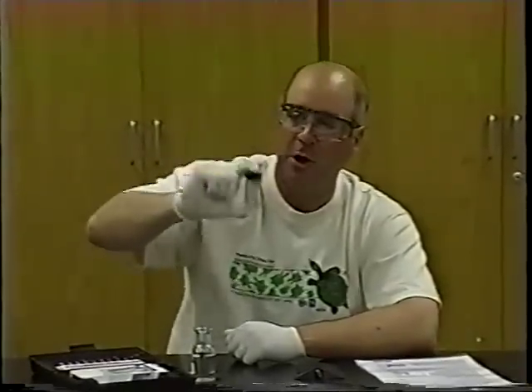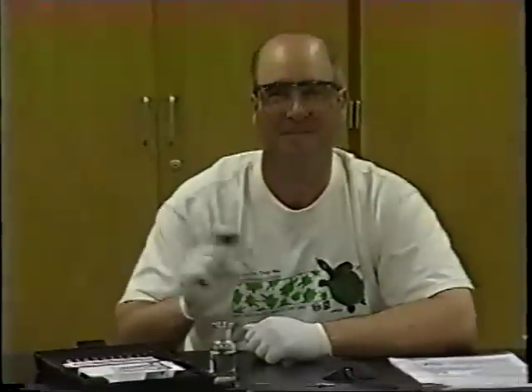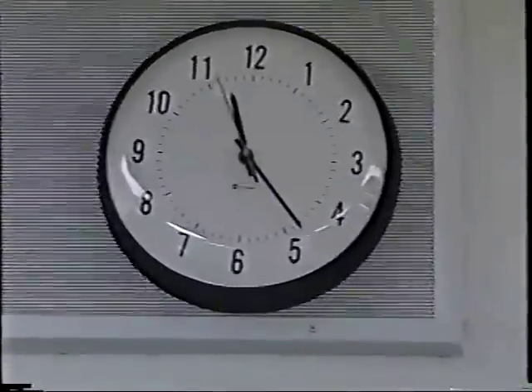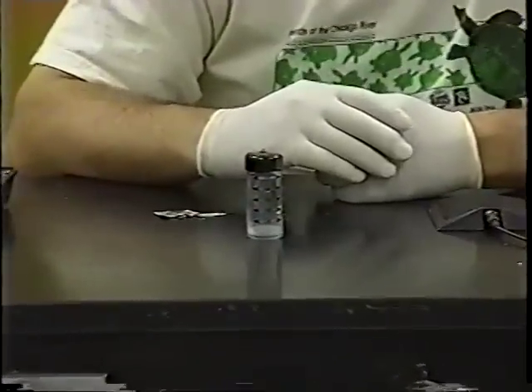You're going to shake this for three minutes solid. I'm looking at the clock right now — I have the cap on, supporting it with one finger and the bottom with my thumb, and I'm just shaking it vigorously. You've got to actually do what it says and shake it vigorously for three minutes. We're going to pause the video while I continue to shake. Okay, the three minutes is over. The next thing it says to do is let it sit for 30 seconds undisturbed. This allows any undissolved particles to settle down to the bottom of the vial.